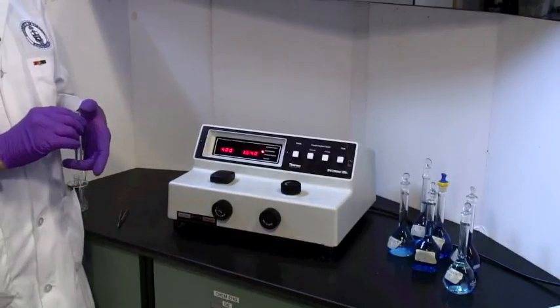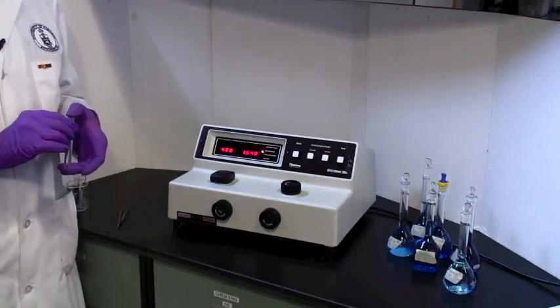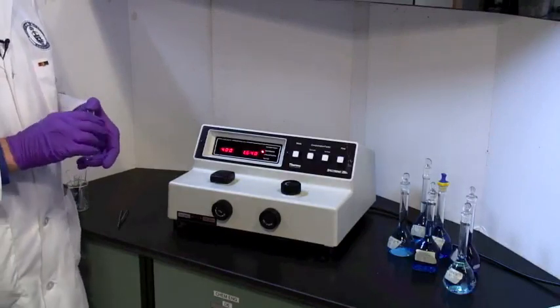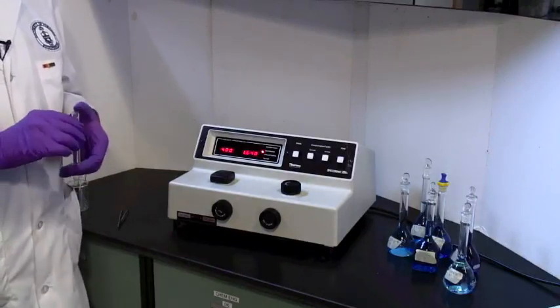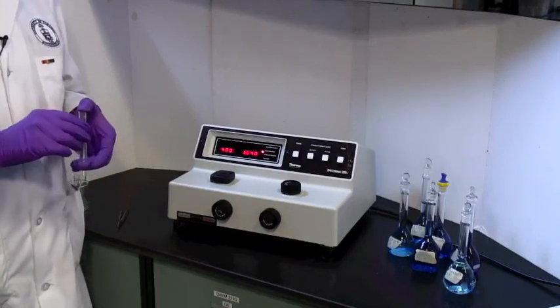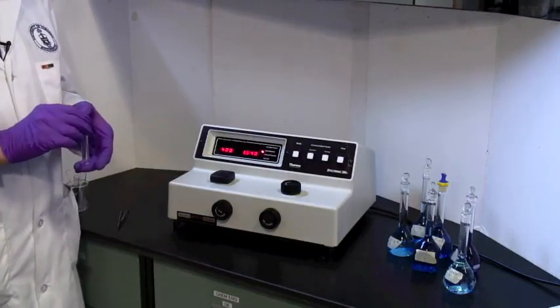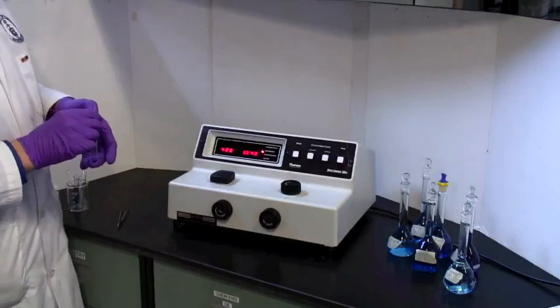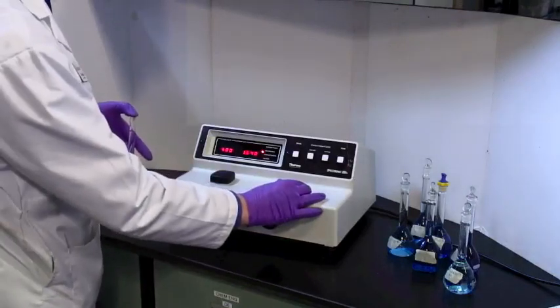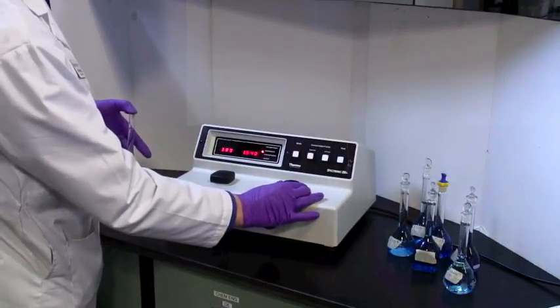The first thing you should do is plug in your spec 20. Let it sit for about five minutes if the lamp is cold. If you're just getting it from somebody else, the lamp will be warm, but the longer it sits, the happier it's going to be. Set the lambda max here on the top knob. We have set this one to 400 nanometers.